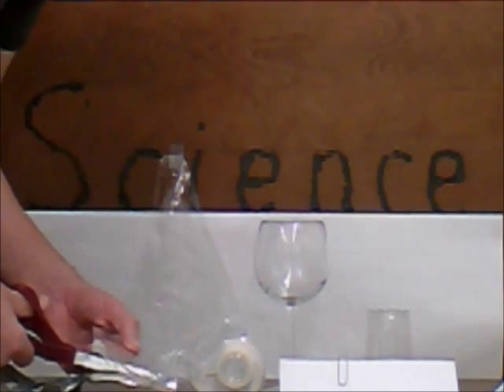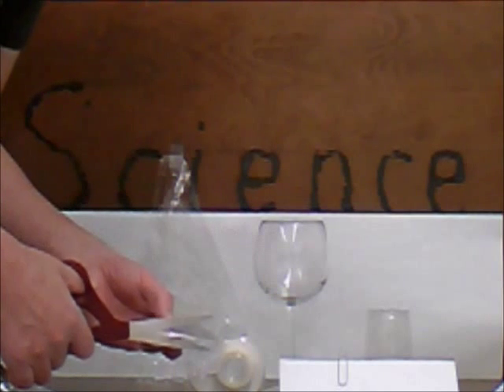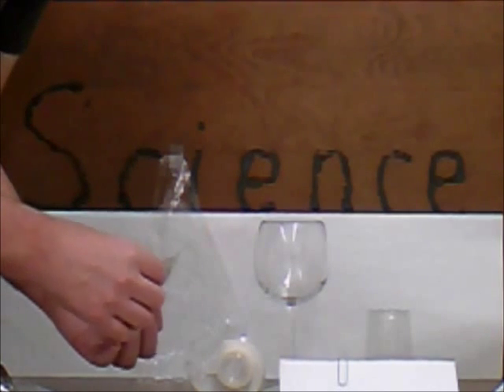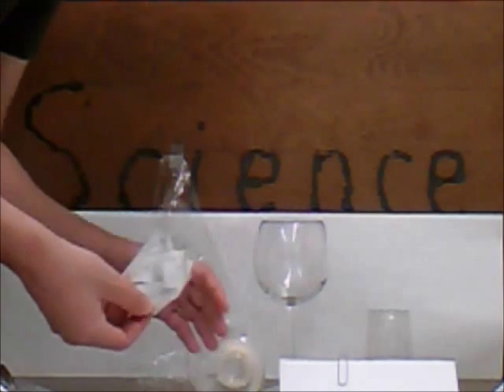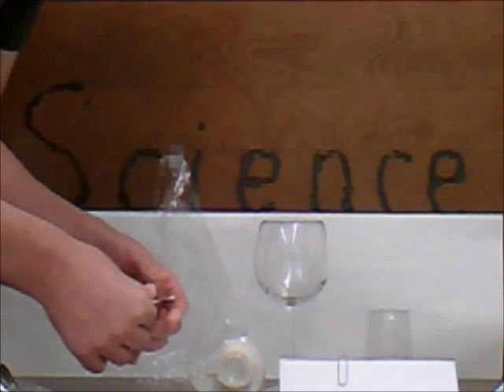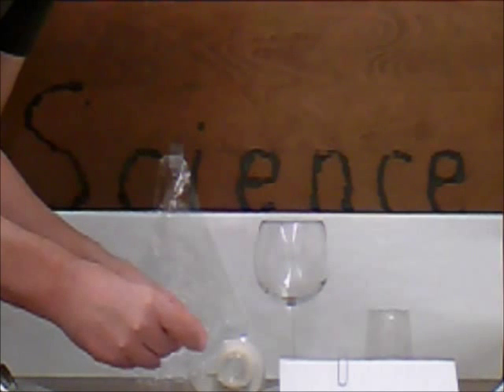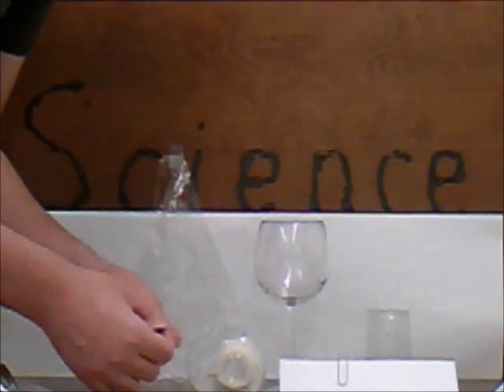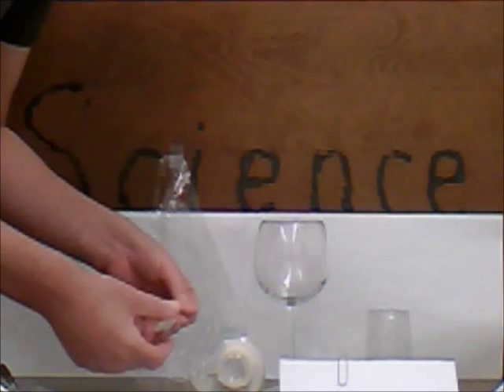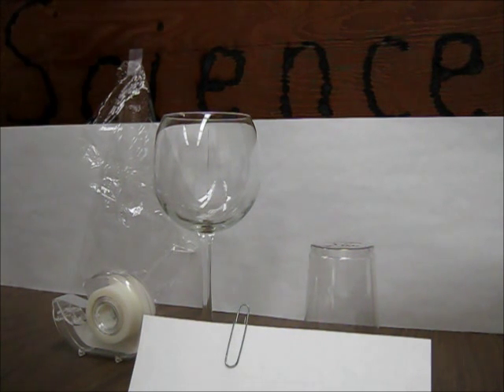Now, if you get thick aluminum foil, you might want to cut thinner, smaller pieces, not as wide, and then just use them as they are. I've got rather thin aluminum foil, which is really the cheaper kind. It works well here. So I tend to like to cut a wide piece and make a few folds. For the device to really work best, thin is really best. But I find that it's a lot easier to handle things if I fold it up. There'll be a lot of ways you can improve this project, but I'm trying now to make it quickly and show you that it can be done easily. What I've just folded up here is really enough for both pieces. I like to take this and put it in the book and flatten it out. I'm going to set my foil aside and go on to deal with my paper clip.